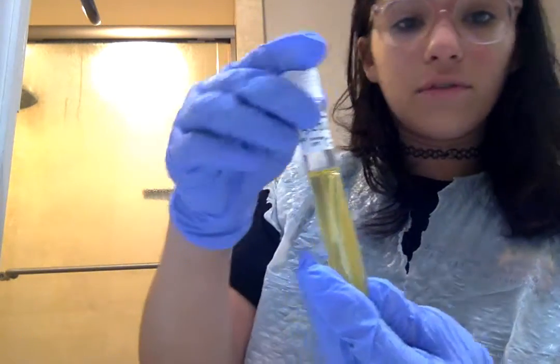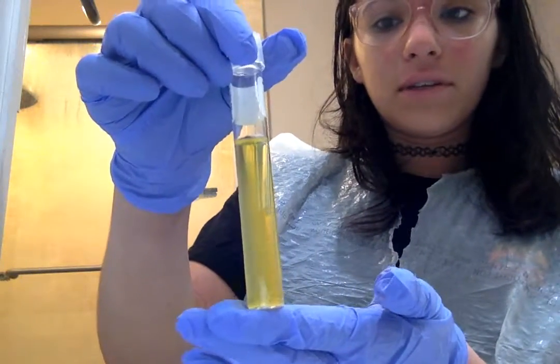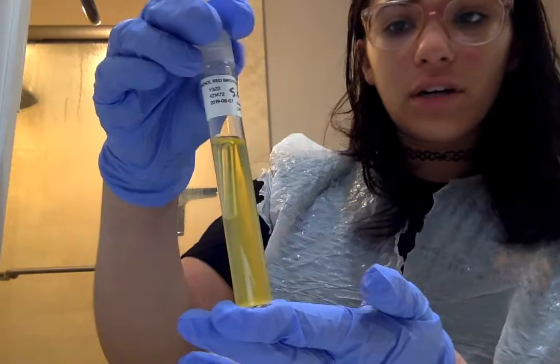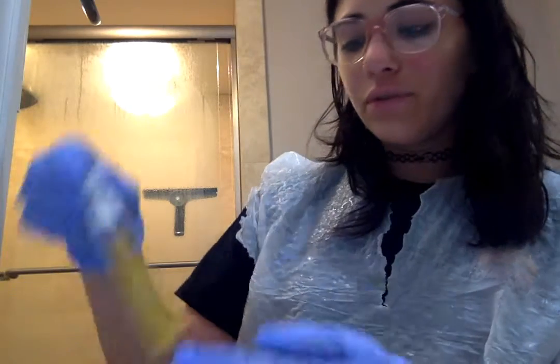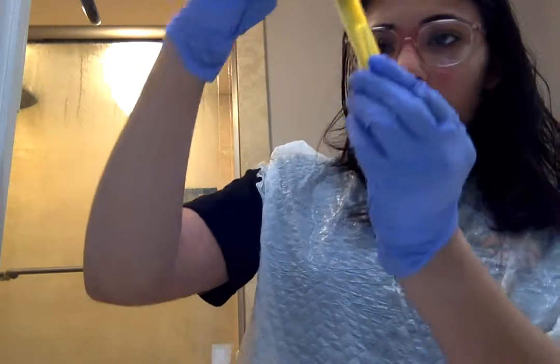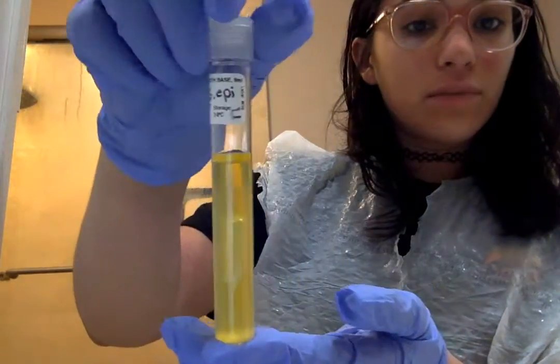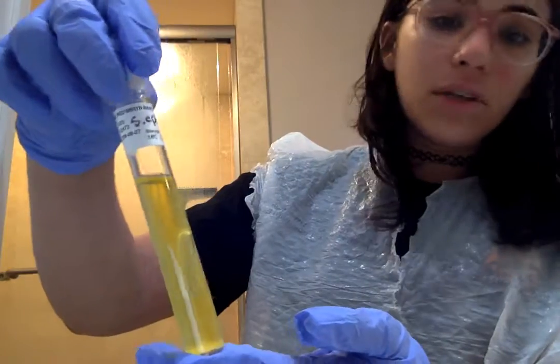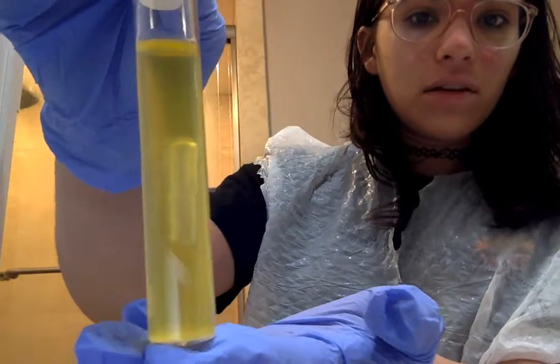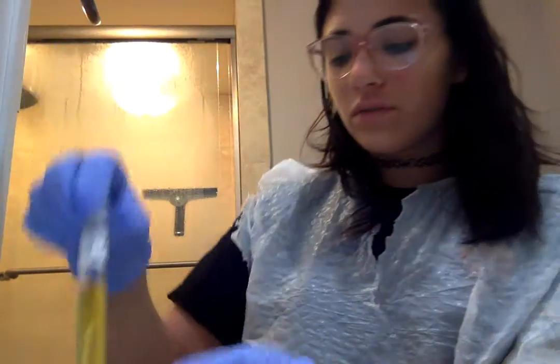glucose and fructose look very similar. They are very yellow. There was definitely some acid production, but again, no gas bubbles. Then we have fructose. Yeah, this one appears to have acid production for sure. The color is yellow, but there is no gas bubbles again, as you can see. So that's fructose. Those are all of them.